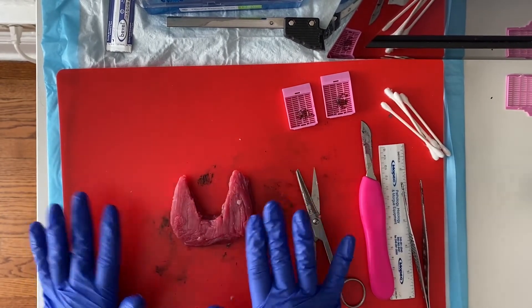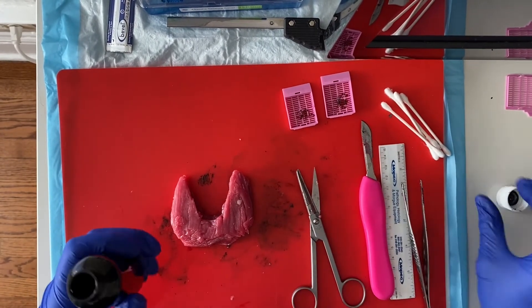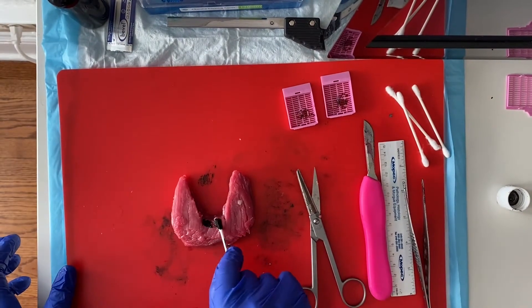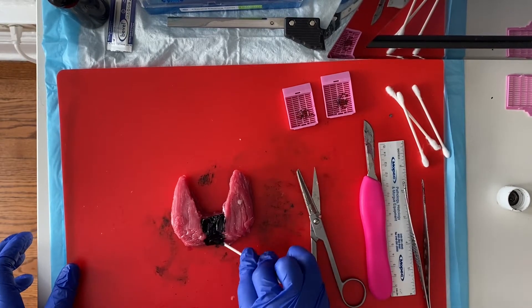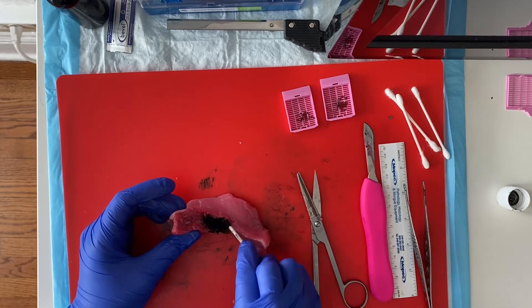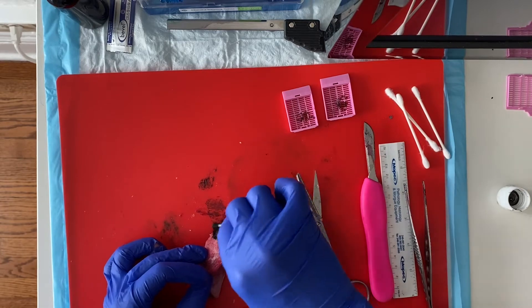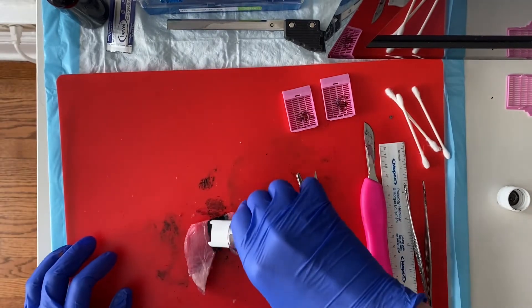I'm going to start with the isthmus and do it black. Where the isthmus begins and the lobes end, I ink right where it starts to join the lobe, and we go all the way around. We will also weigh it. There's our isthmus inked all the way around. We will mordant that now.